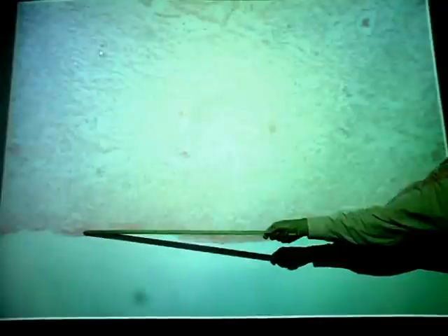Okay? Any questions? Again, I'm not going to ask you from the slide what phase it is, but you should be able to pick out the layers. Stratum functionalis, stratum basalis, the endometrium, myometrium. In this case, you can actually see the perimetrium. Pink layer here.